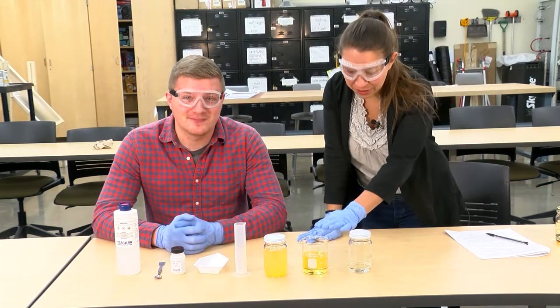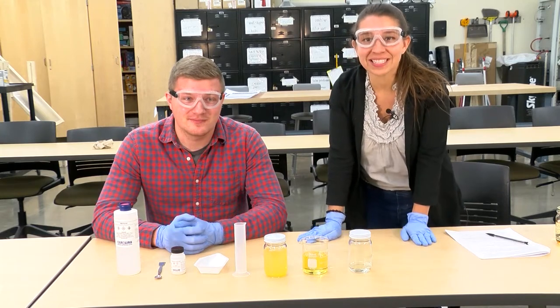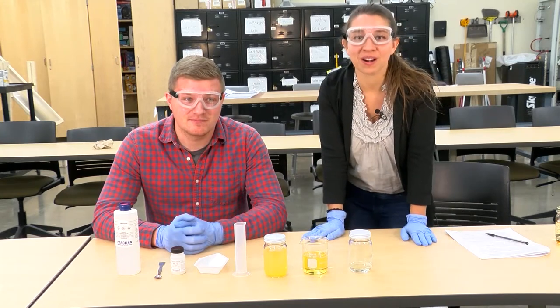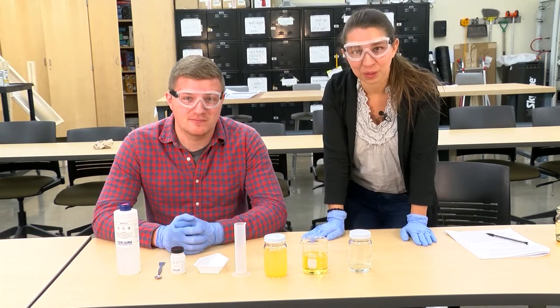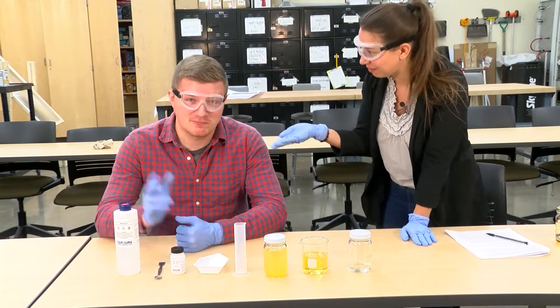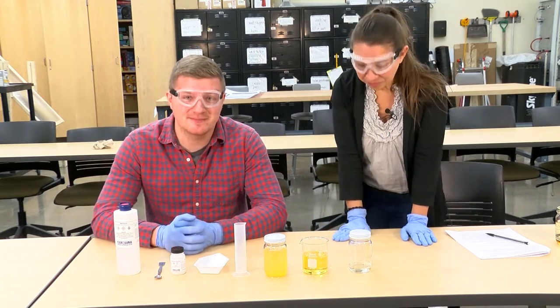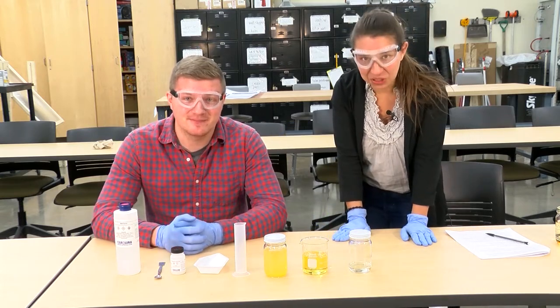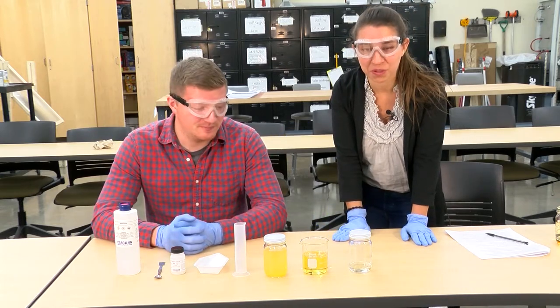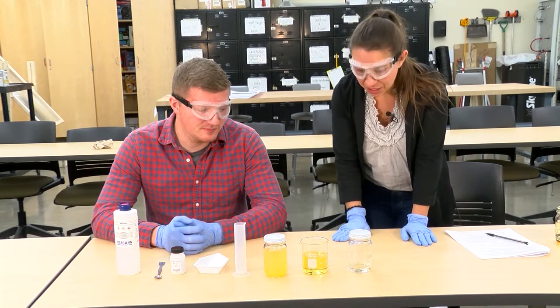Joining us for part two, now that we have our completed oil, is a student from our Sustainability and Renewable Energy Systems major. Hello, I'm Davin Subotky, and he's going to walk us through the transesterification process.